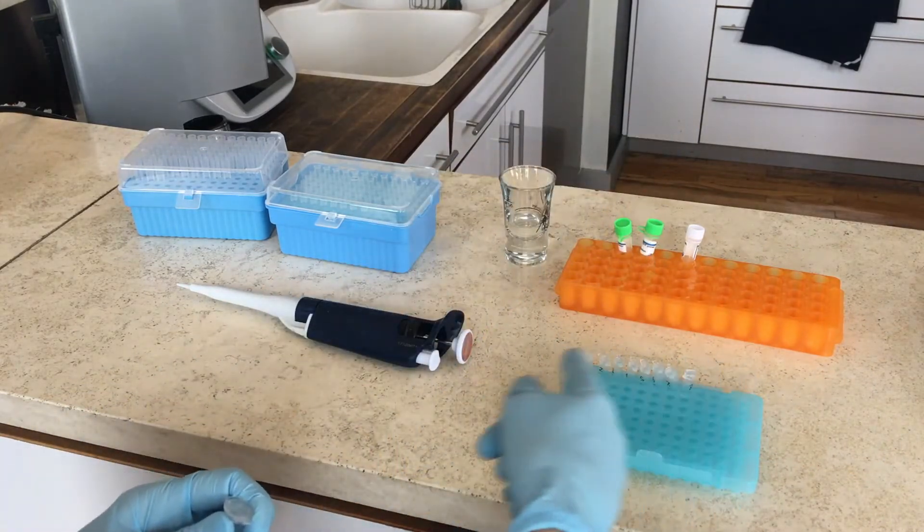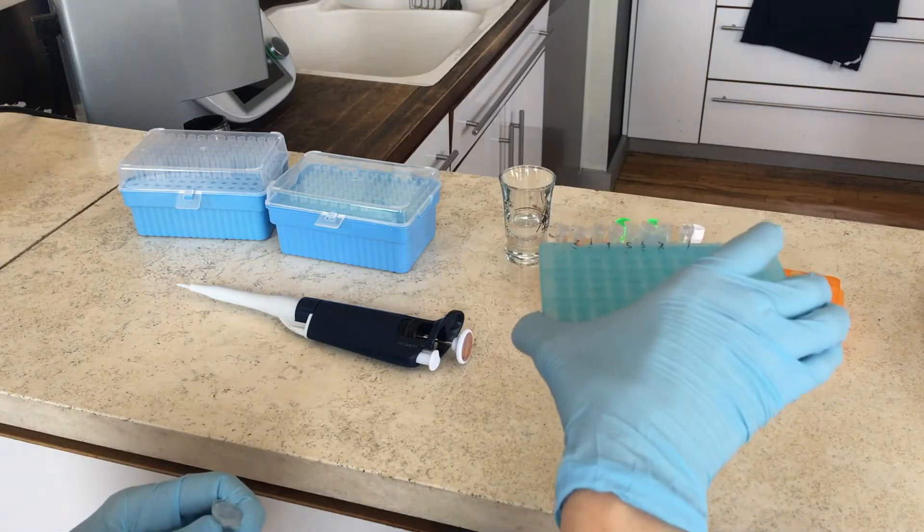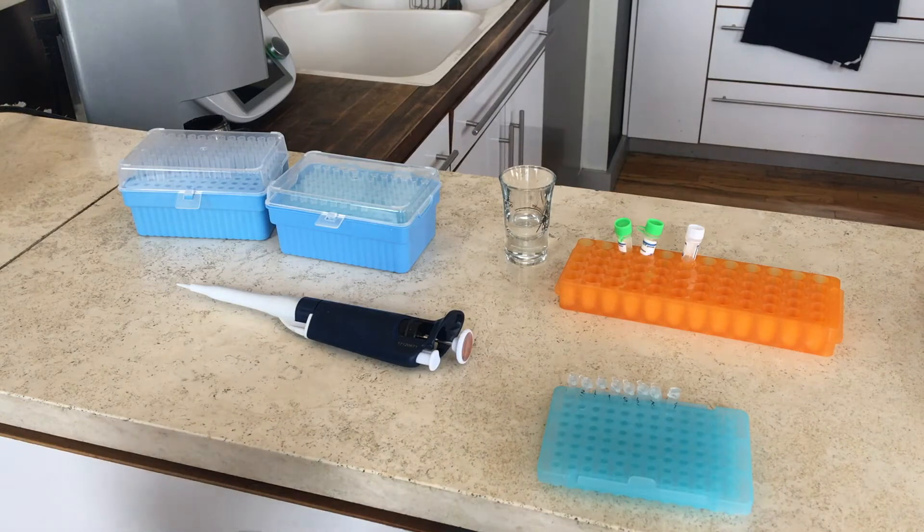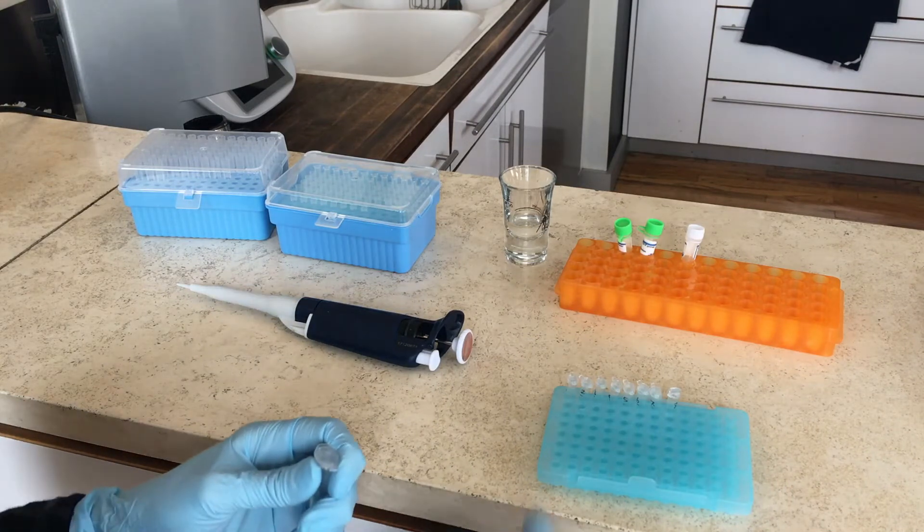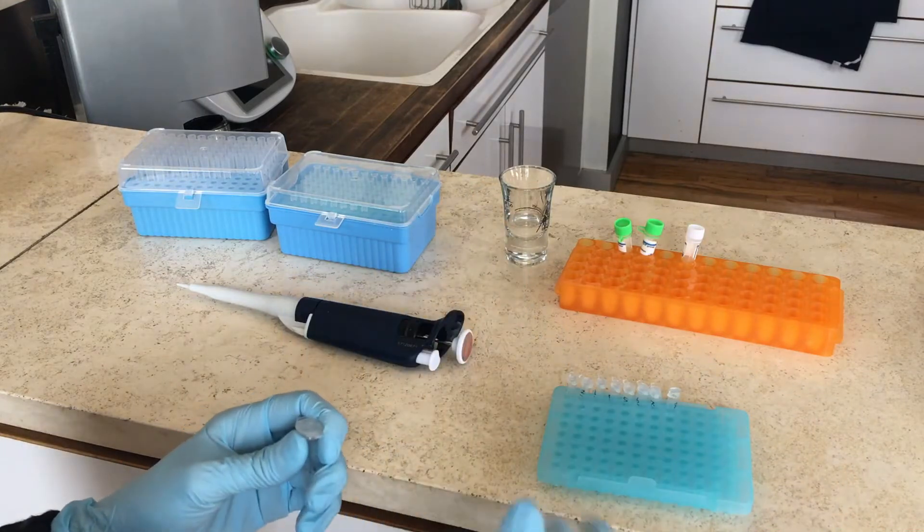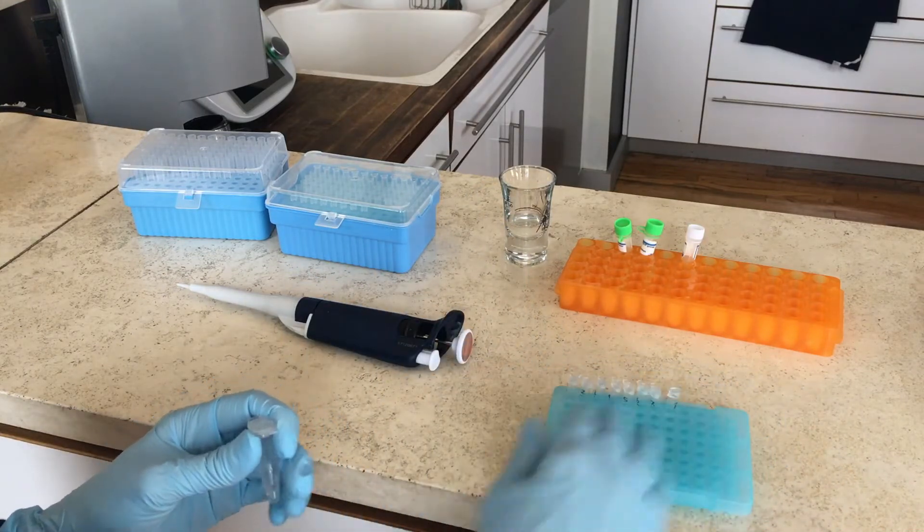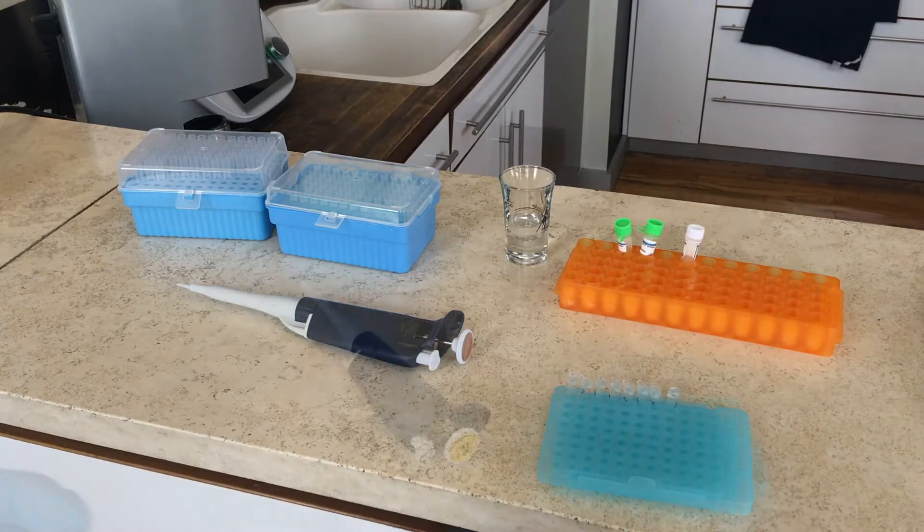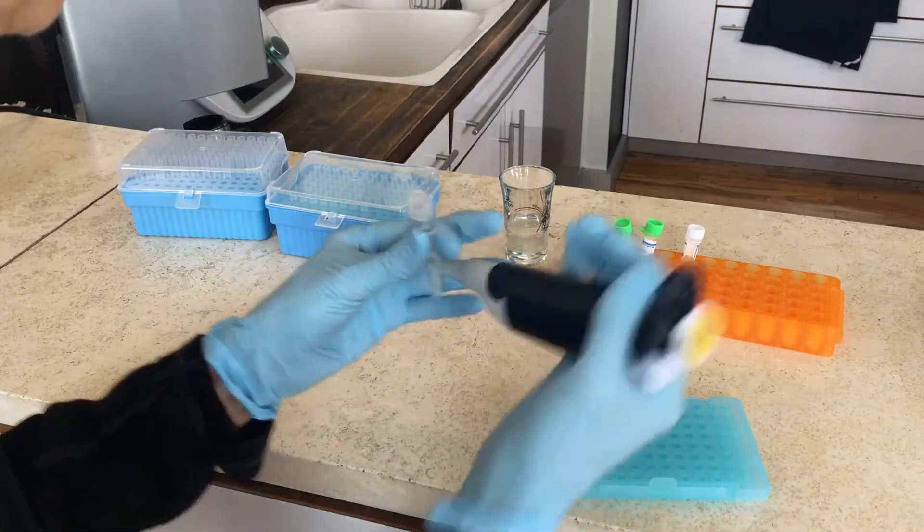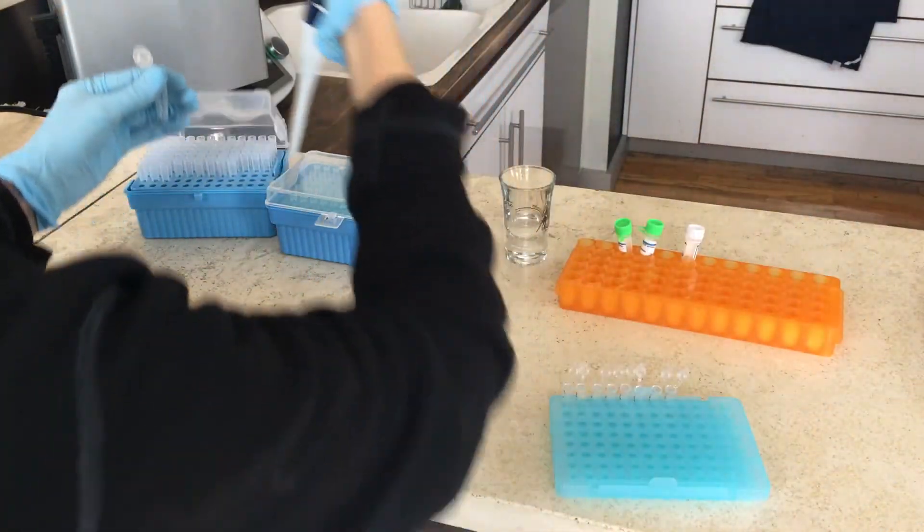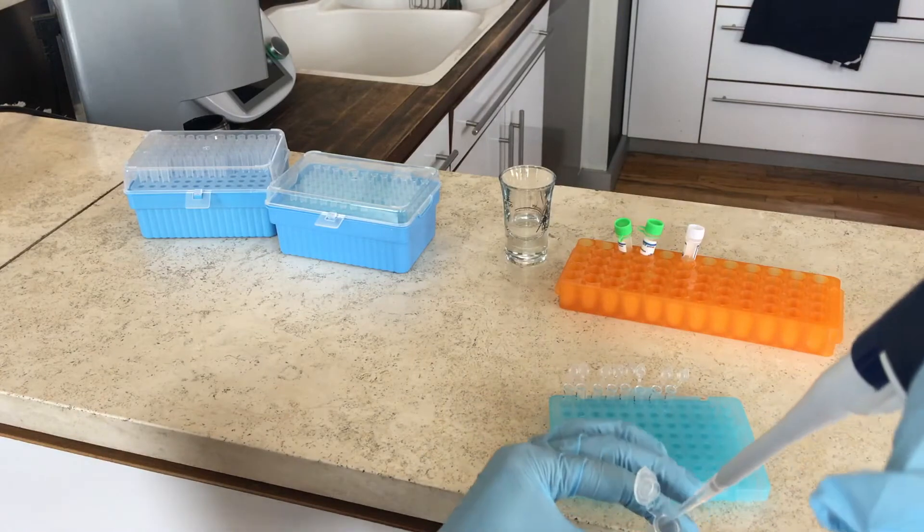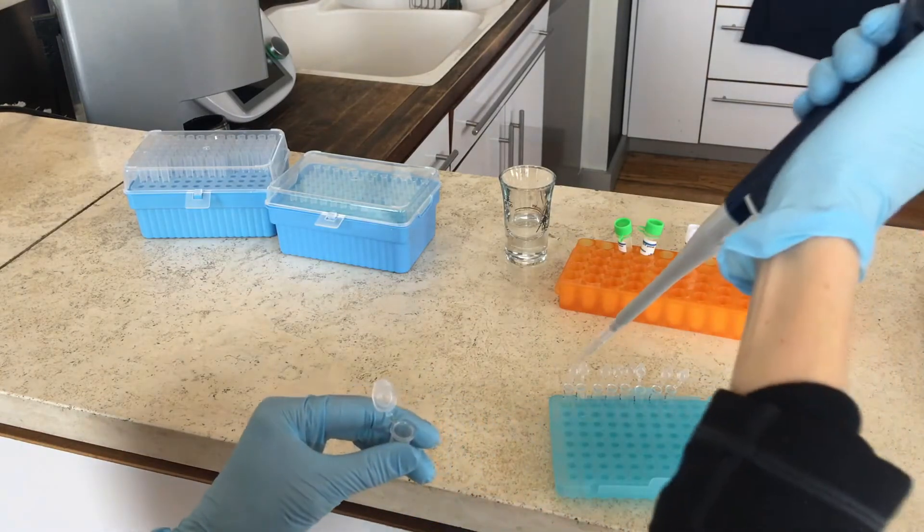These are not the tubes that are in the centrifuge right now. These are entirely new empty tubes that you've kept closed. So you're going to portion the mix that you had in equal parts into these tubes, and that's about 20 microliters per tube. So I'm going to take a pipette tip, do the usual, put it in there, and then distribute it into each of the tubes.